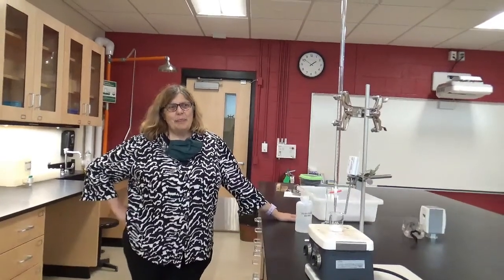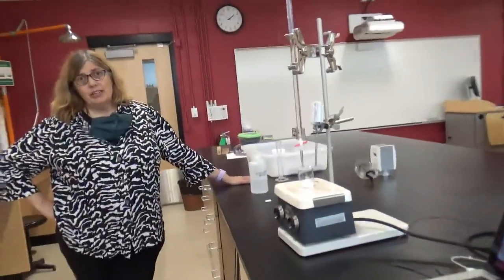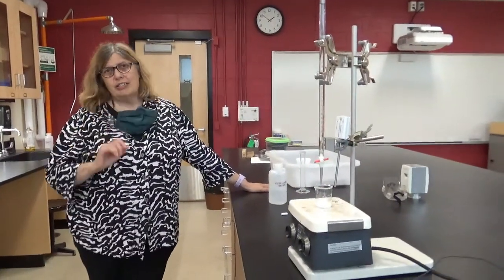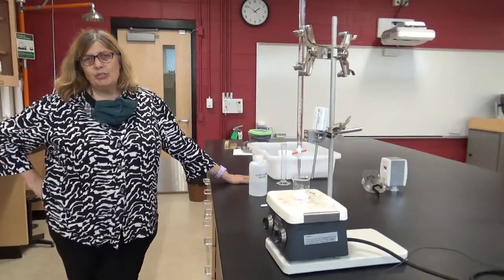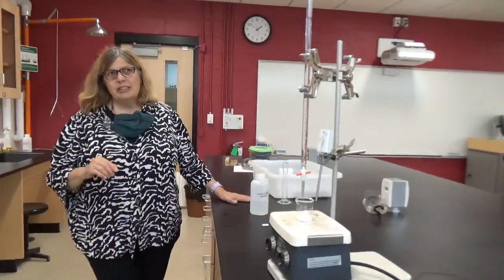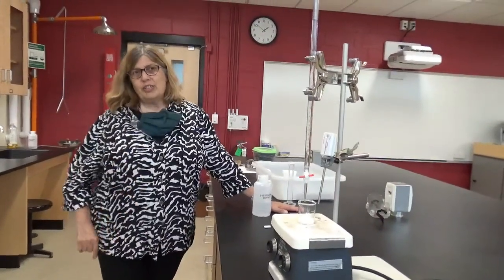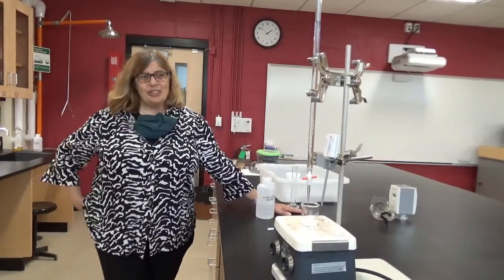Okay. We're about ready to do the second part of this lab, which is to dissolve the urea in water, but to only just dissolve it. In other words, we don't want to add more water than we need to just exactly get to the point where every one of those grains of urea disappears. So in other words, we're making a saturated solution. And the concentration of the saturated solution is actually the equilibrium constant in molarity units.